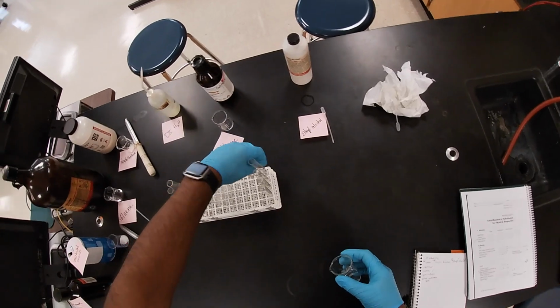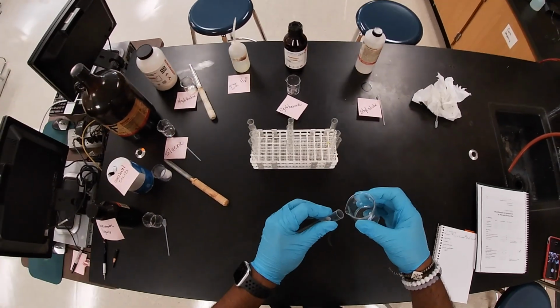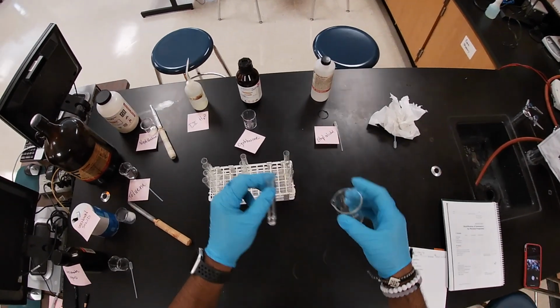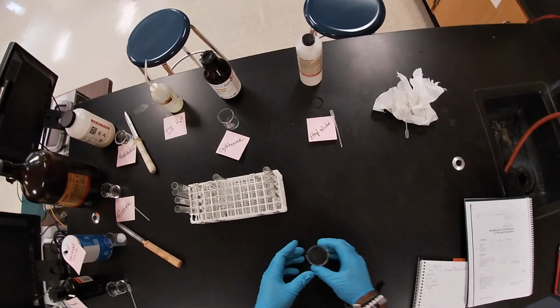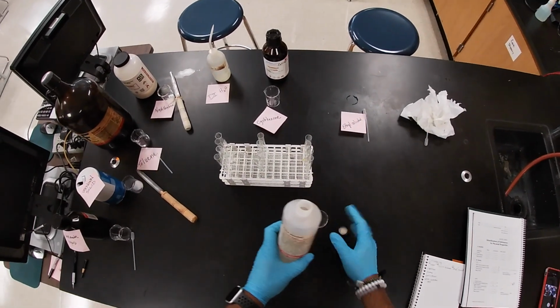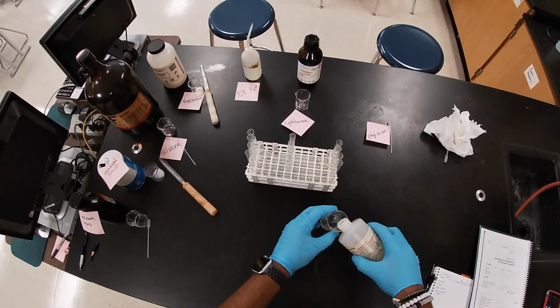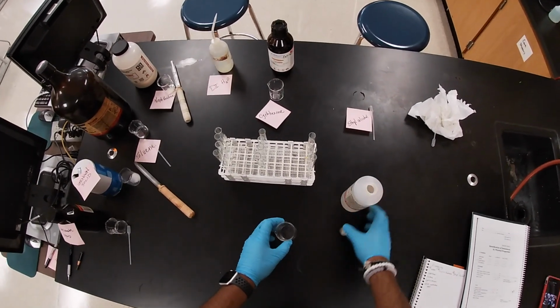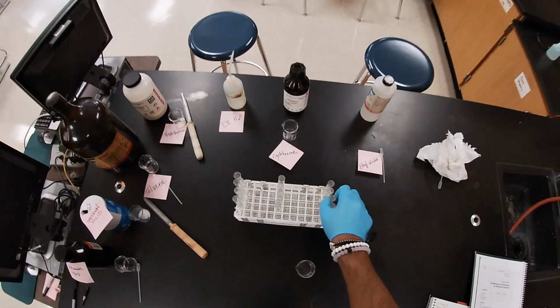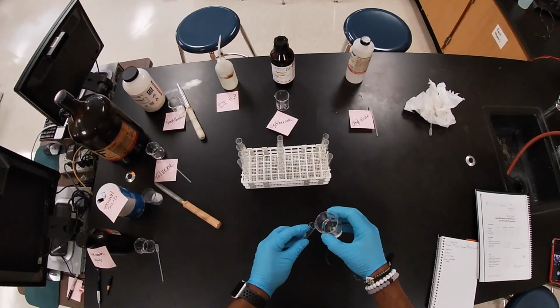Okay, got one. Got two. I need some more on that one. So again, I'm gonna get some more ethyl alcohol or ethanol. Make sure that after you use every single chemical, you close it.